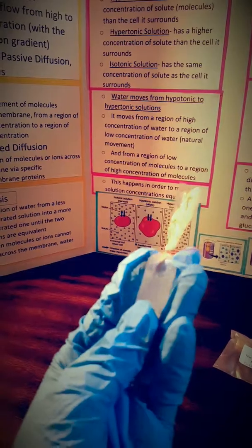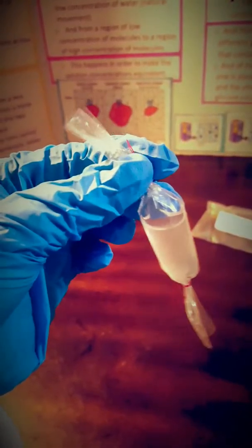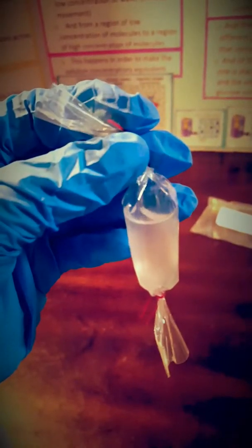Okay, so here I'm back. I put some gloves on. You don't really need to since it's just a glucose solution, but you know, trying to give you all the works. So this is a dialysis bag. This is kind of how it should look. Once you put your solution in, you can use a transfer pipette for that. You should leave a little bit of space, like a little air bubble at the top, as you can see.